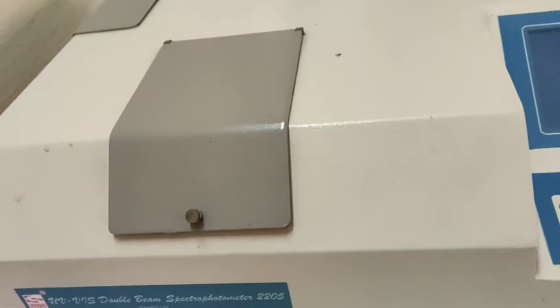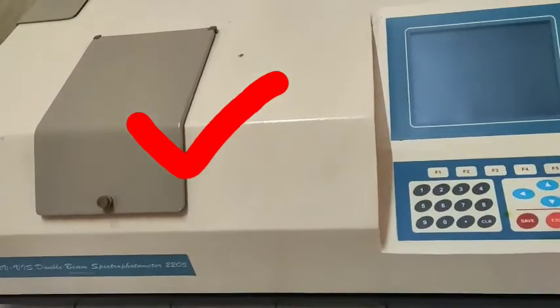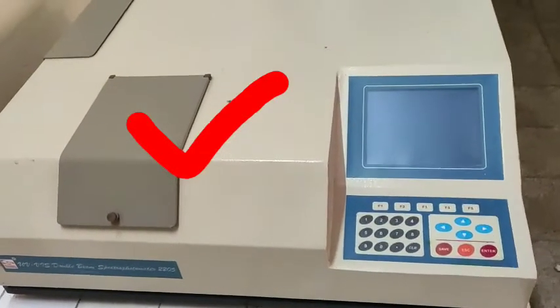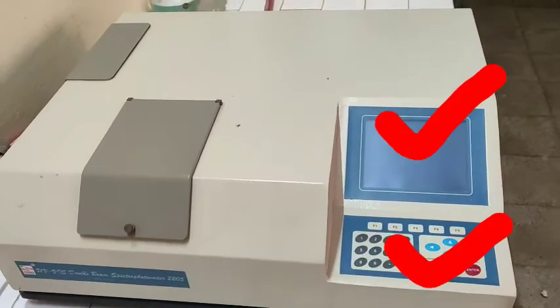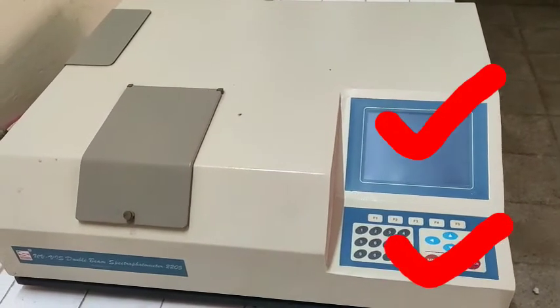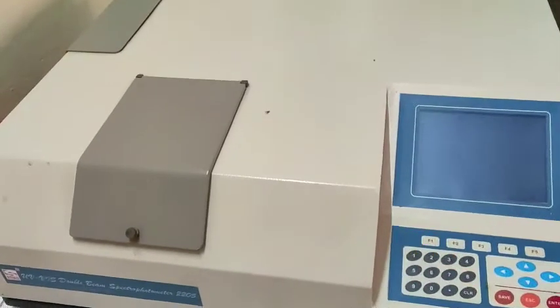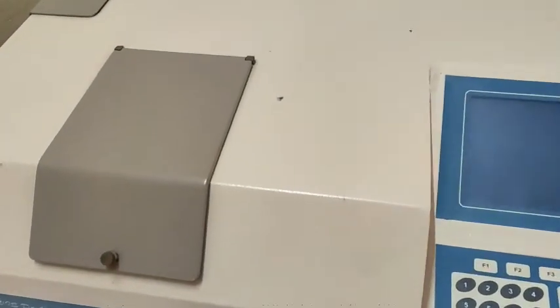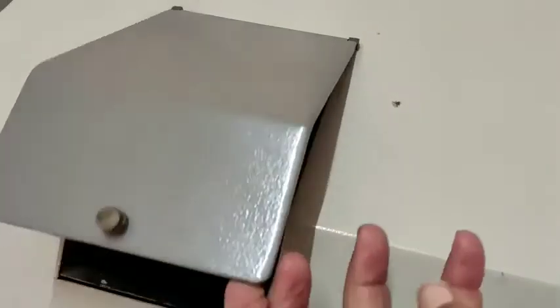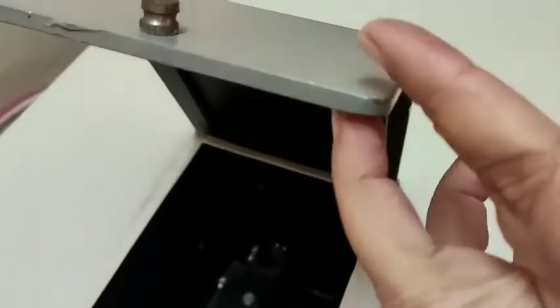In the sample chamber you can easily place two cuvets at once — one for reference or blank, and the other for the solution. You can see the display and keyboard, which are inbuilt in the instrument. Then we will open this chamber — you can see that there are two stands for cuvets.